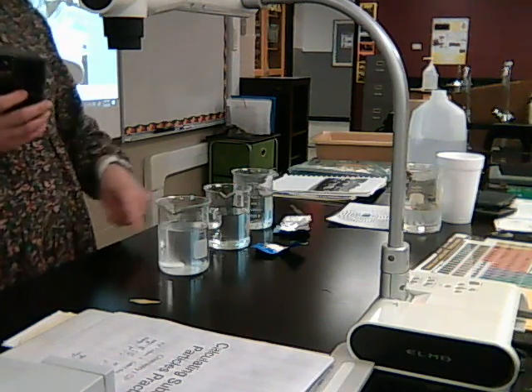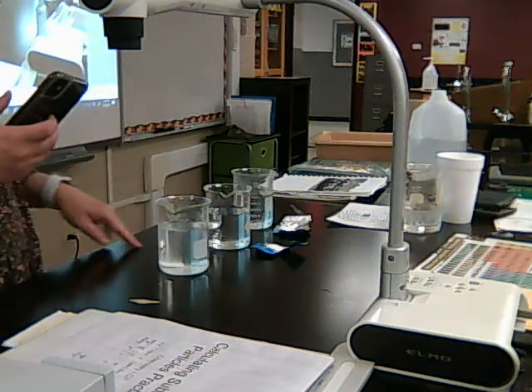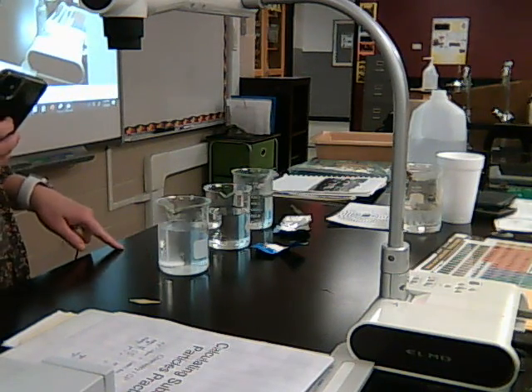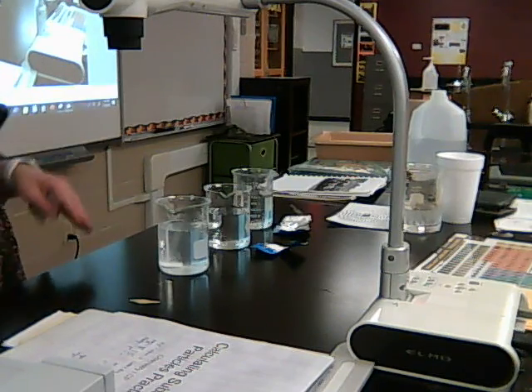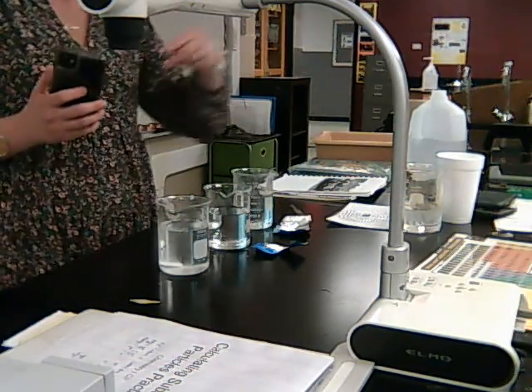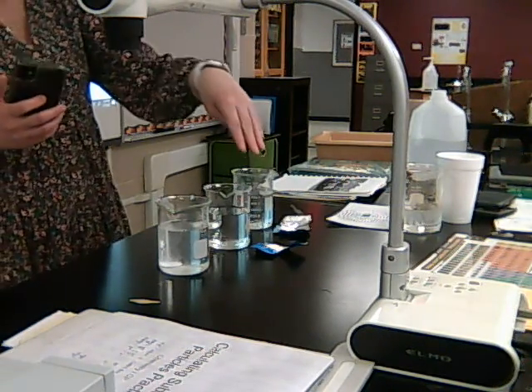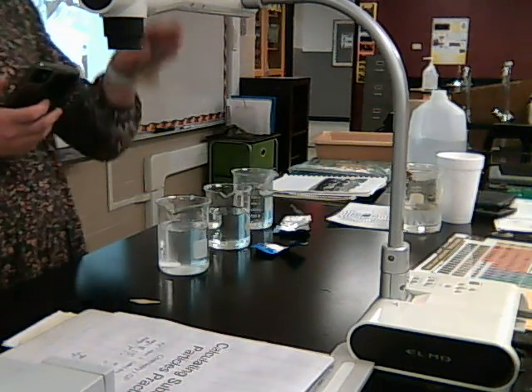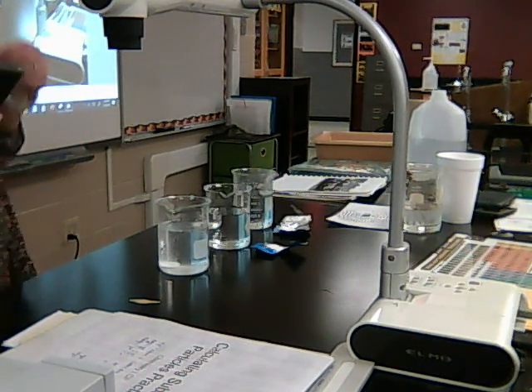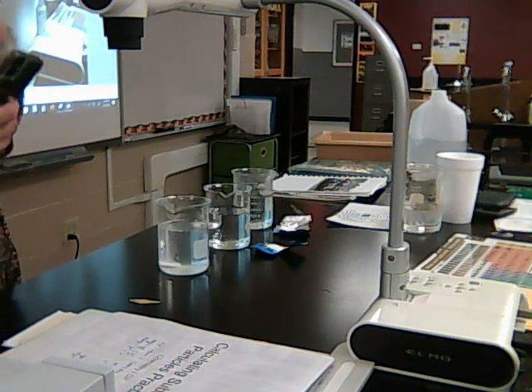Now remember this whole one, does it have the most or the least amount of surface area? The least amount. Because again, this one doesn't have as much on the outside as these others do, because these others I have opened up the inside to the outside. So they have more on the outside than this one does. So this one has the least amount of surface area. Even though it's the biggest tablet, it has the least amount of surface area. So we have to keep telling ourselves that so we don't get confused.